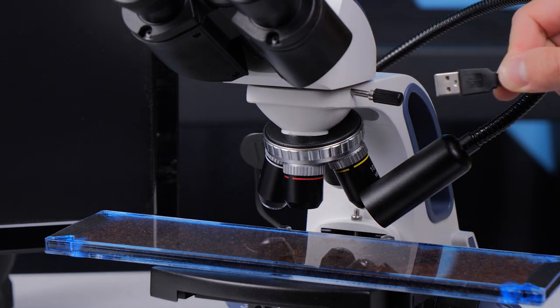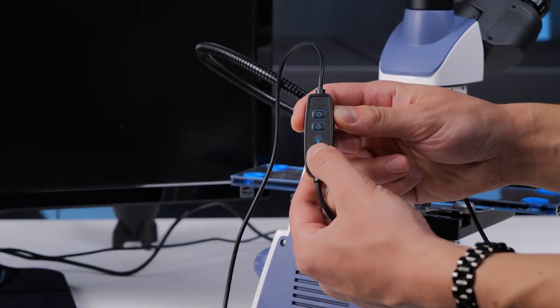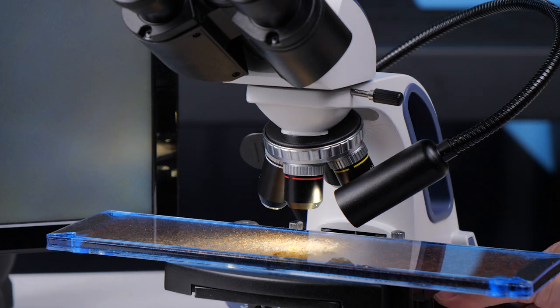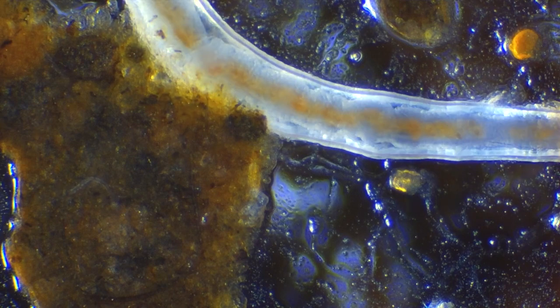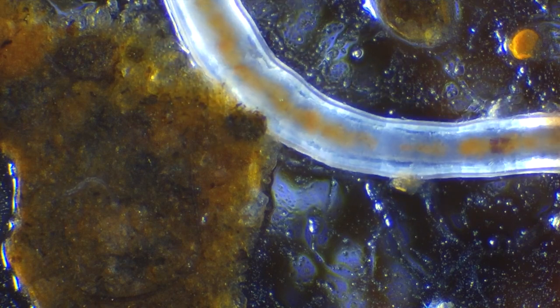The gooseneck light has a USB plug on it. You can plug this into any USB port to power it. You'll want to use MicroSafari Terra with the 10x eyepieces and the lowest magnification objective to start. Like Aqua you can only use the 4x and 10x objectives due to working distances.